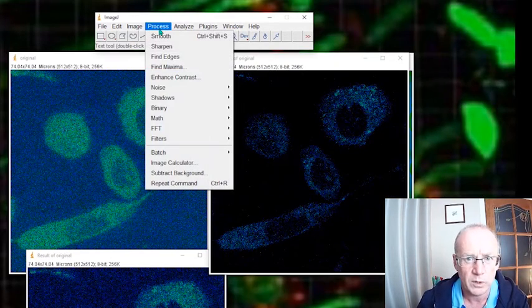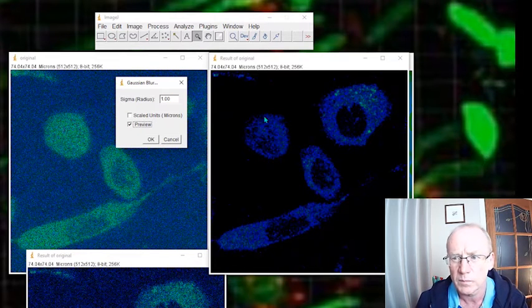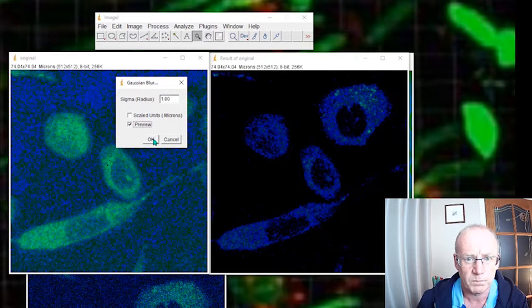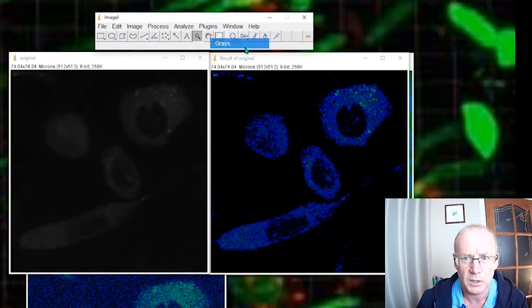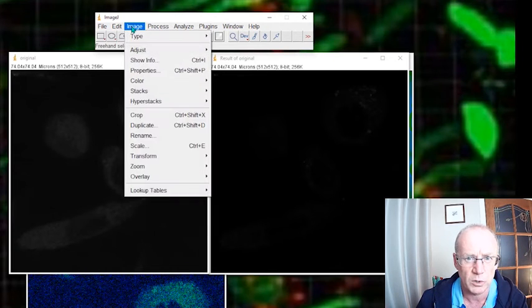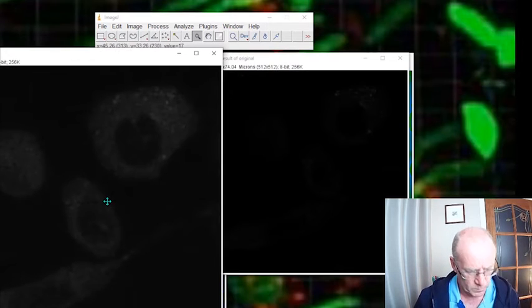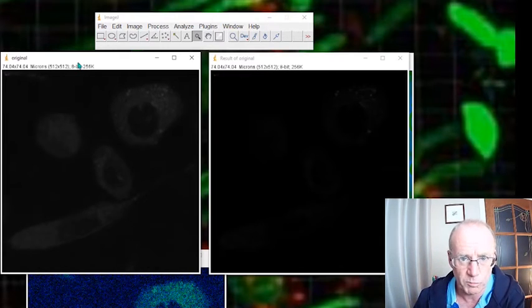What if we were to do a little low pass on that? Let's just do a little Gaussian blur. Preview that. That looks not too bad. We'll stick with one. Let's do a Gaussian blur of the original image too. Very nice. What if we then made them back to grayscale? Can barely see them. Well, let's enhance the contrast. Because of all these manipulations, it's really important that you don't use these images for anything other than illustrative purposes.